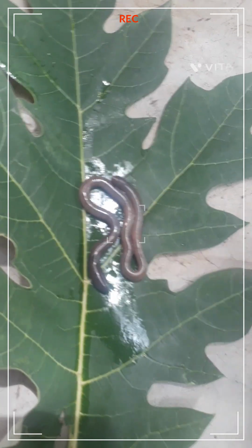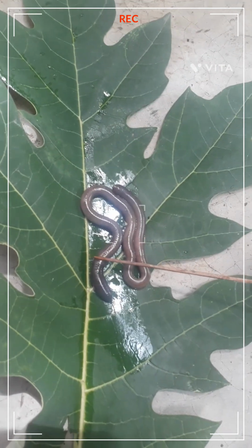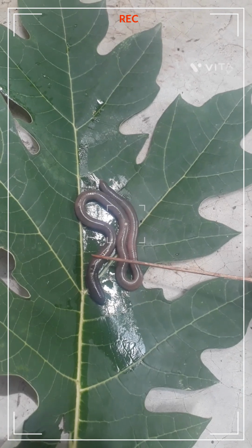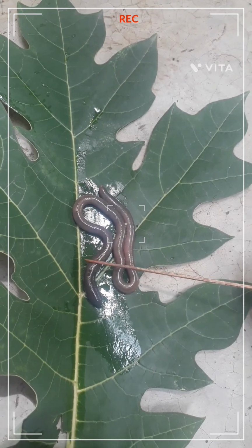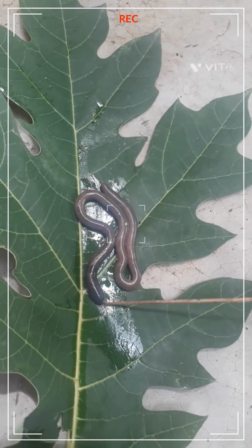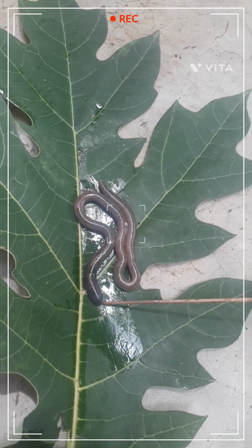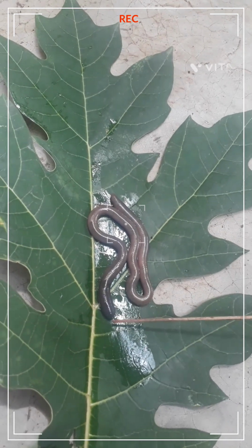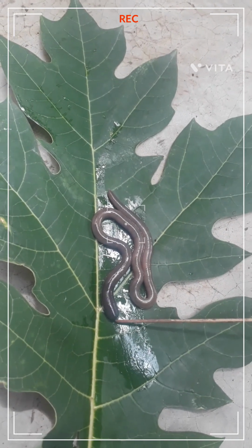I think you are able to see the dark portion. Up to this dark portion is called the anterior part of the earthworm. The anterior part consists of the mouth. It is present here, and the prostomium is above the mouth.